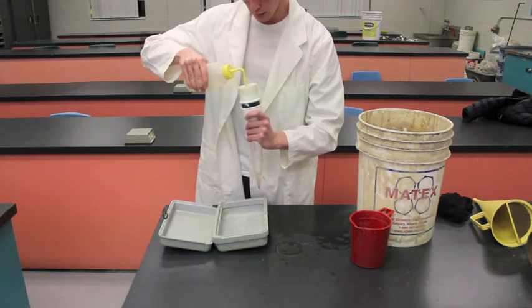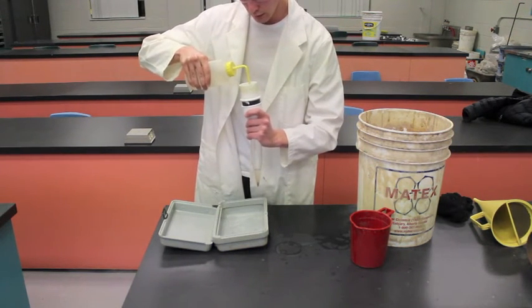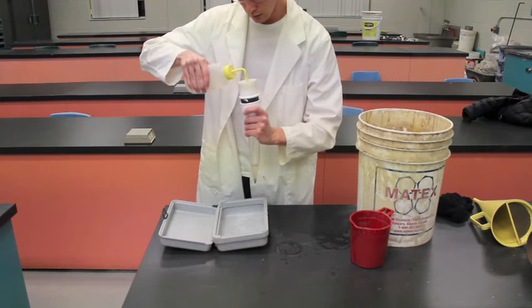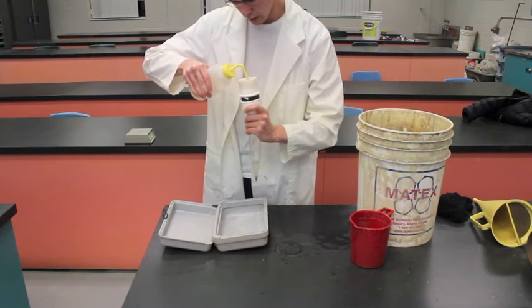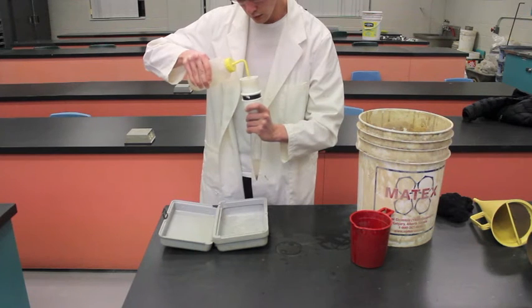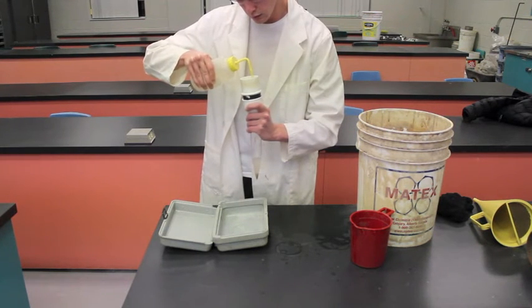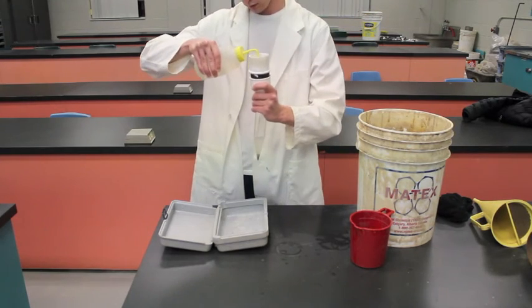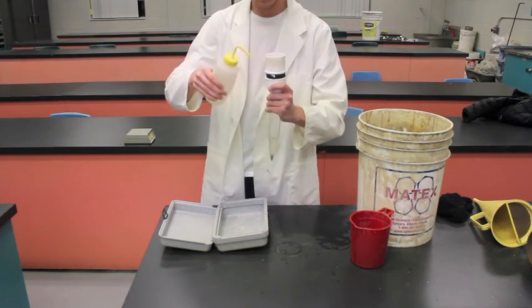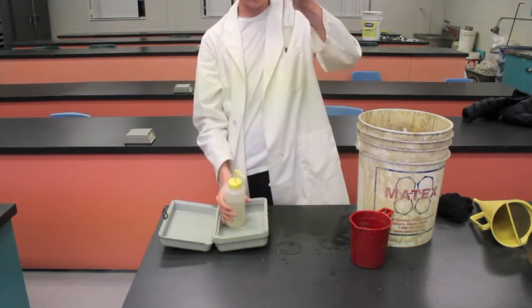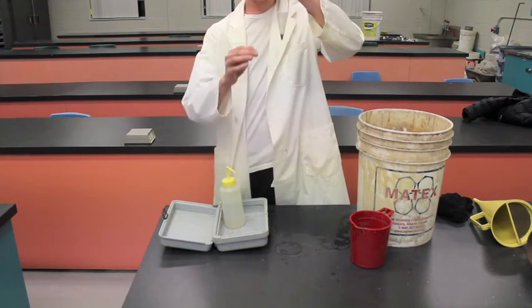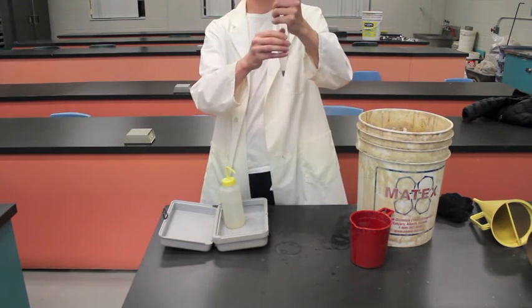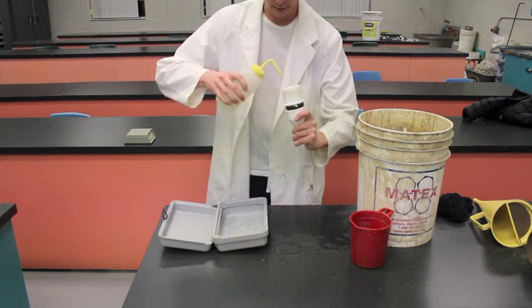So now you want to spray that screen out ensuring that you get all the sand on the screen. Looks like we're done. There you have it. And as you can see too, as it fills up, we're starting to see the sand settle at the bottom so this is exactly what we want to see in this test.